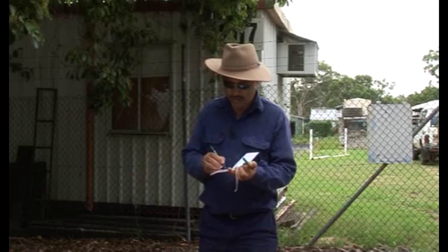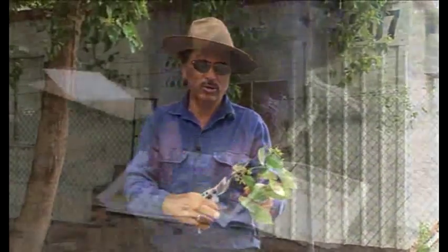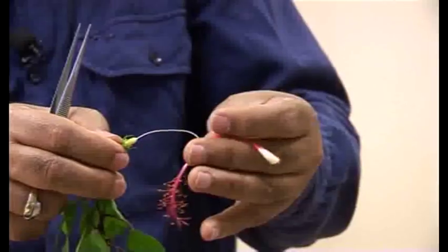The next part of the exercise is to identify the unknown specimen. You've already collected it and pressed it, transferred it down to the white page, and then you've dissected the flowers and collected the information. Now you need to find out what genus it is or what family it belongs to. The best way to do that is to assume that you don't know anything about the plant and then try to go from an unknown specimen to a relatively familiar specimen.